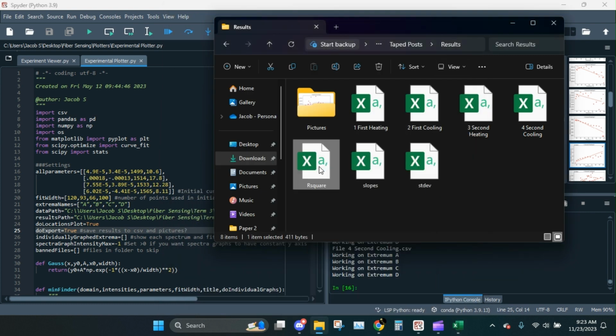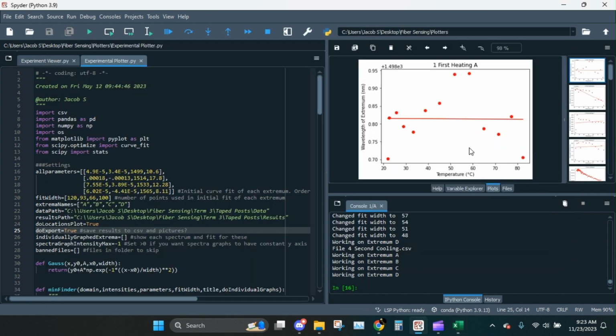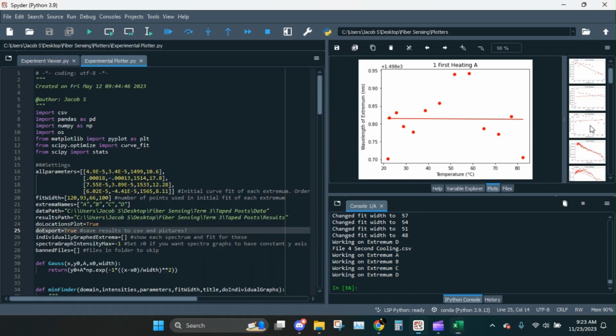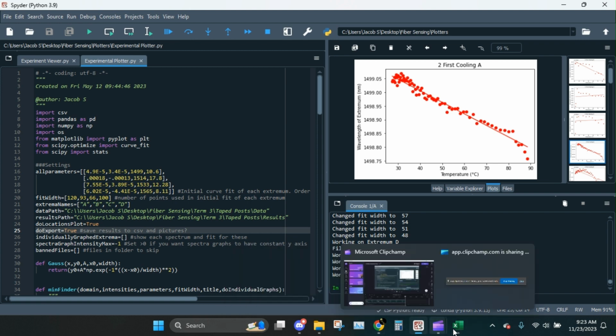And then, for instance, R squared to see if any of them were actually nice linear fits. Which, looking at the pictures, not all of them were. Oh, there's R squared. Yeah. So, like, that first one, 1A, pretty obviously not a very good correlation coefficient there, right? So, nearly zero. A for the first cooling was actually pretty good. Let's see if that corresponds here. Yep, so we can see that was a pretty nice line. And so on.